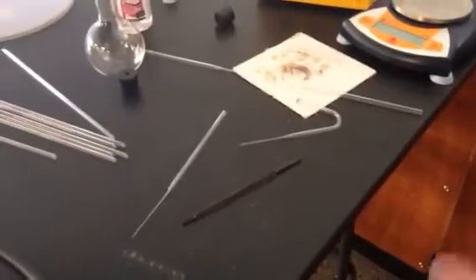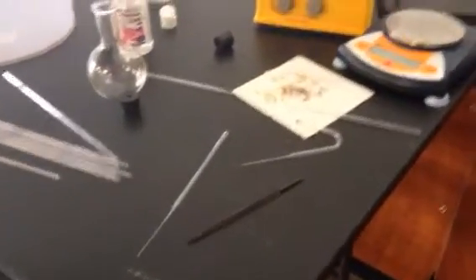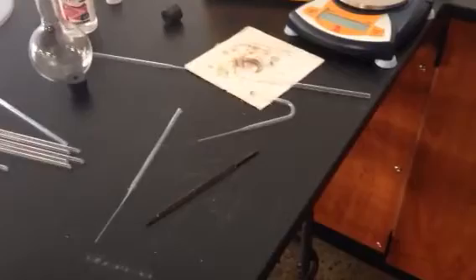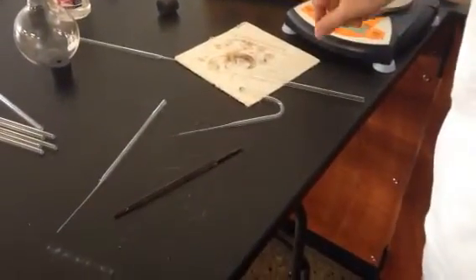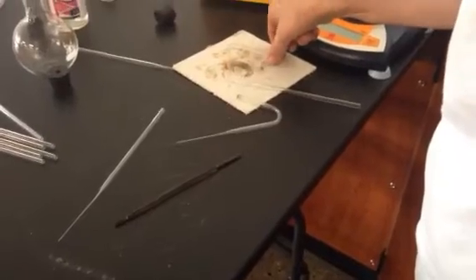Keep track of the hot pieces. Don't touch those with your hand. Hot glass looks just like cold glass, and people get burnt a lot of times in this lab just from picking up their glass too early. What I really need is a piece of cool glass, which I'm not sure I have.